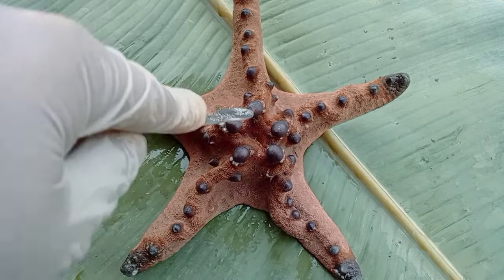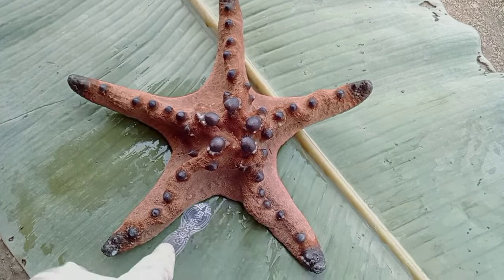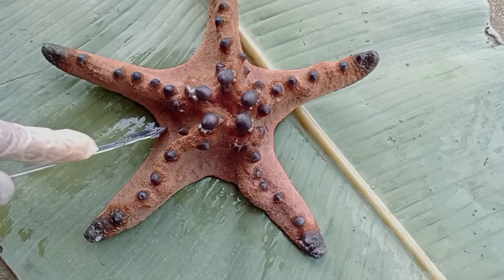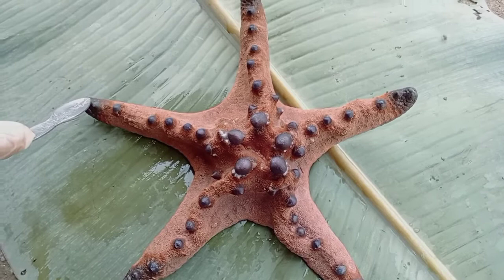This part is the anus. This part is the bivium. The interambulacral. This is the terminal tentacle. This part is the trivium.